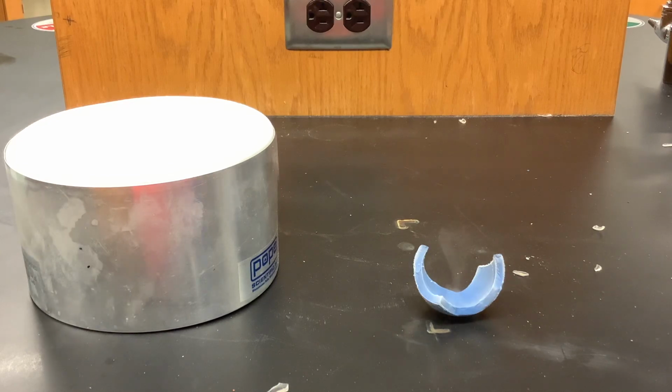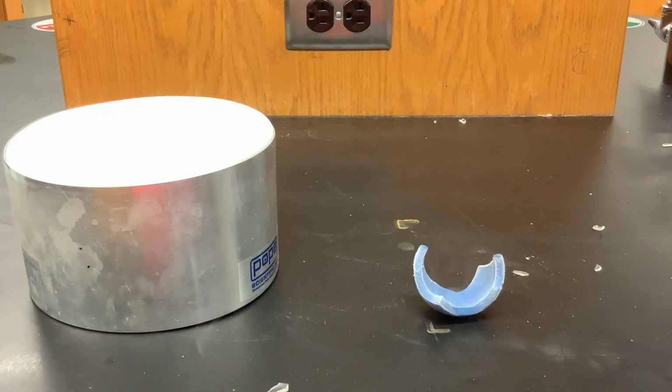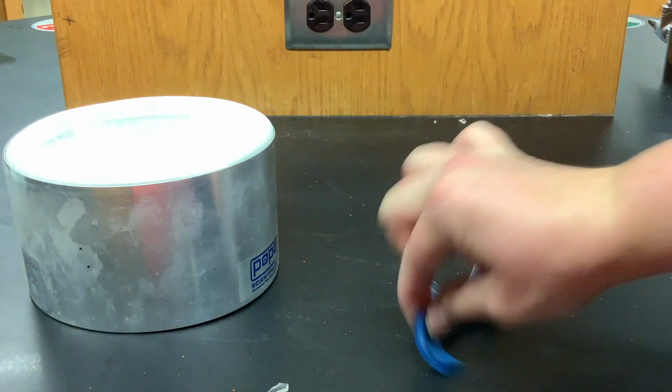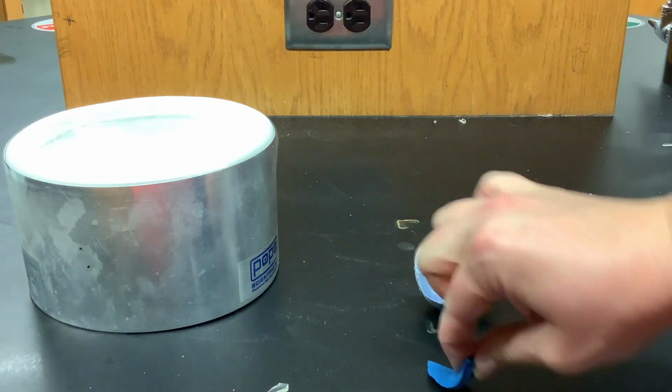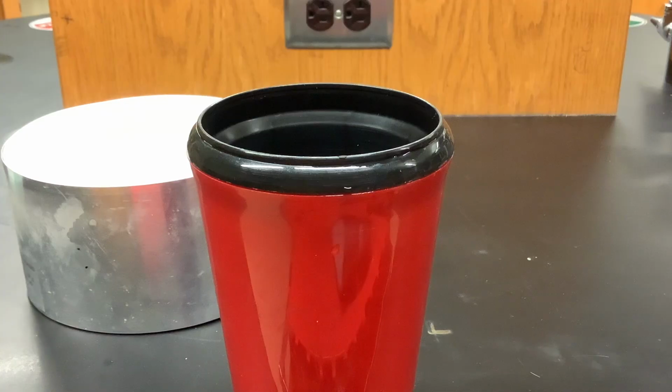So I have a piece here that I've warmed up in my hand. So you can tell by the color that it is different. The piece that is still cold has frost all along the outside. It's freezing the air vapor around it. The piece that I've warmed up in my hands is now returned to its flexible state. So this is a reversible process for some things, but for your body, for cells, once that cell wall is broken, it cannot be repaired.